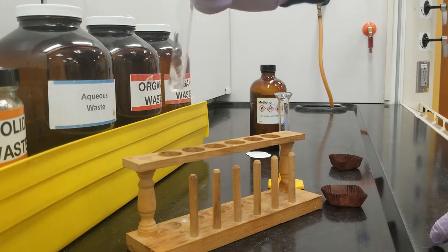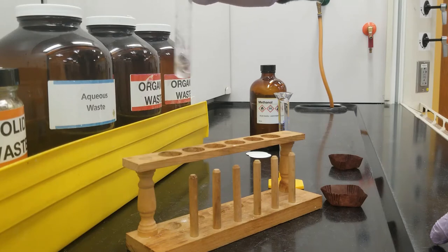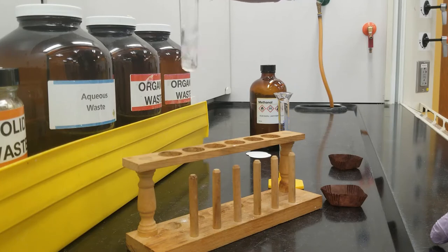So benzophenone has those two big phenyl rings in its structure, and so it's going to be rather nonpolar. Methanol has a moderate polarity, and so it's able to dissolve a wide range of substances. And that's one of the reasons that we're using it today.